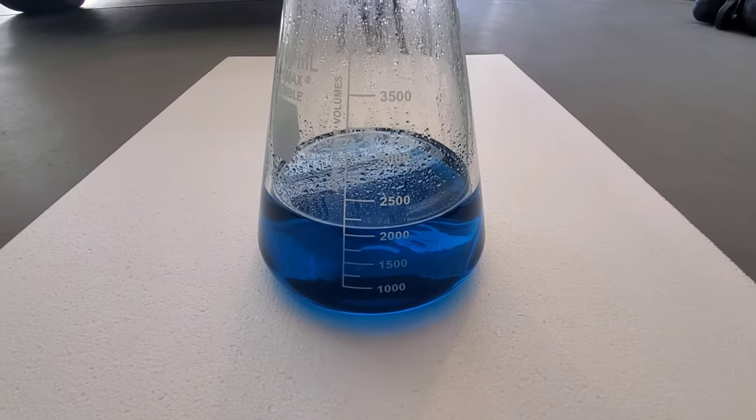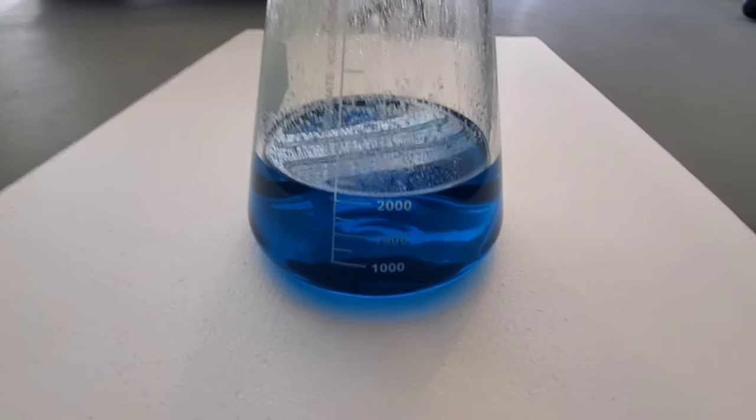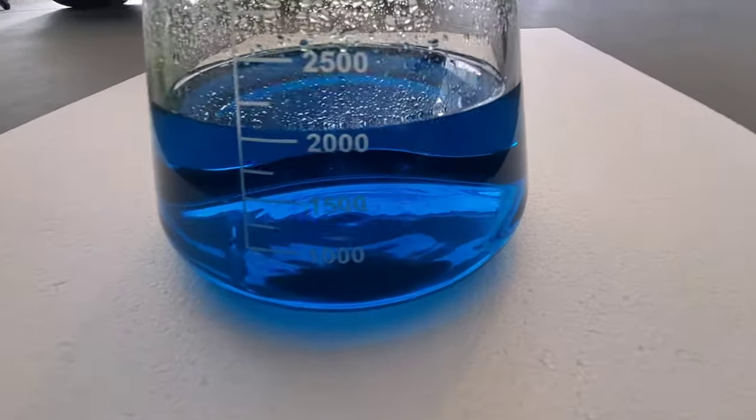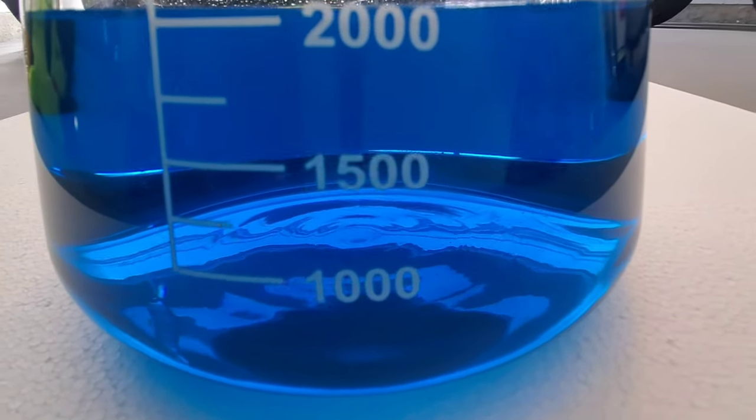Here's our silver nitrate, basically liquid silver, all filtered out. No impurities in there.